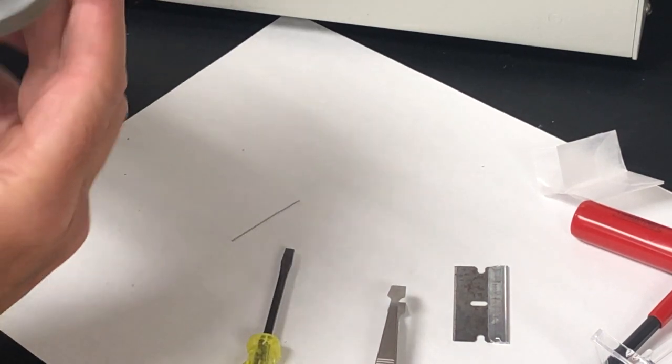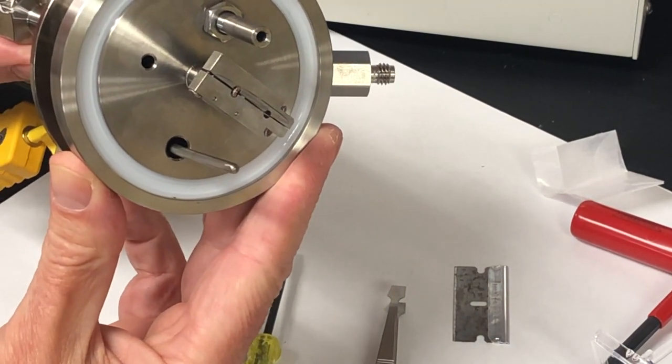And now the crystal should be properly mounted so that we can test it out with the QCM oscillator.